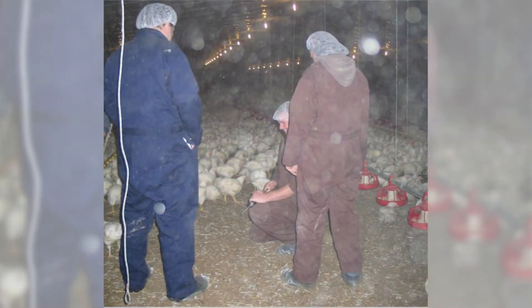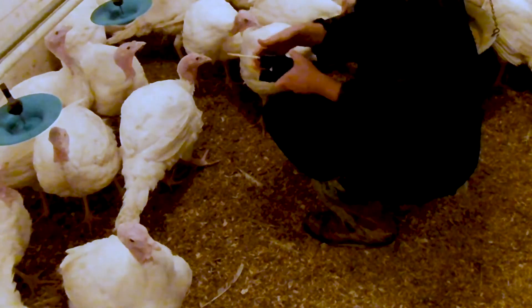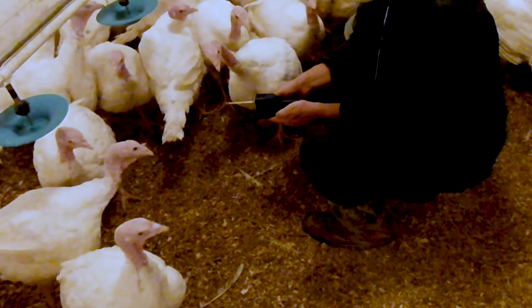The pump draws air through the tube for several seconds. It is very important to hold the pump such that the air pulled in through the tube comes from the location of interest. For example, if animal welfare measurements are the goal, this means holding it near the bird breathing zone during the sampling period.